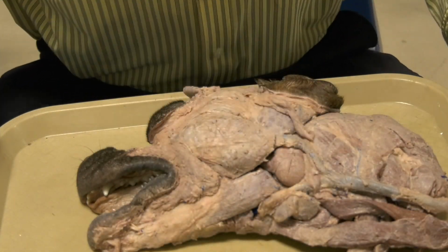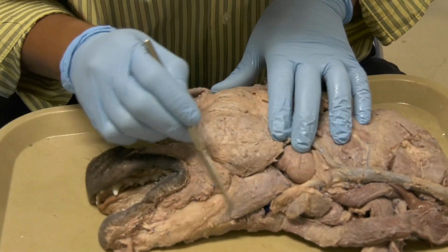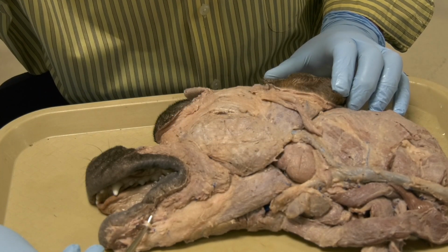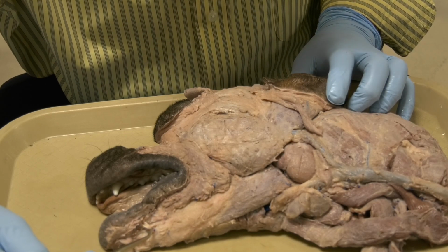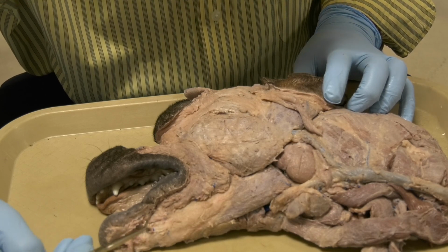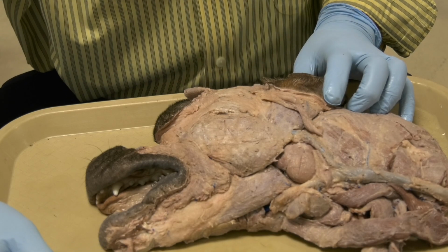Regarding the nerves, okay, this is the mandible, okay, this is the area for the mental foramen. This nerve you see here, this is the mental nerve that is coming out of the mental foramen to provide sensation to the lower lip, and we said this nerve, you can block it at this level here where it is coming out of the mental foramen.